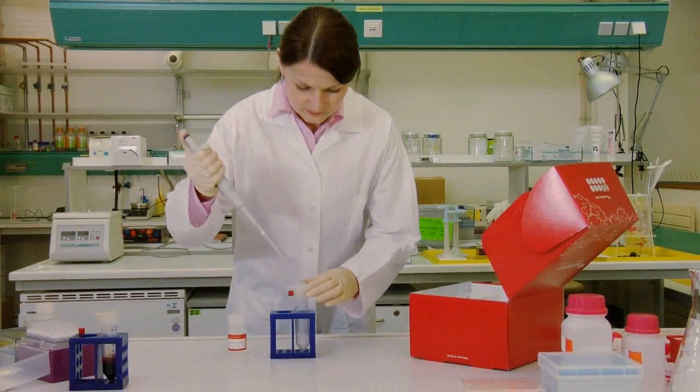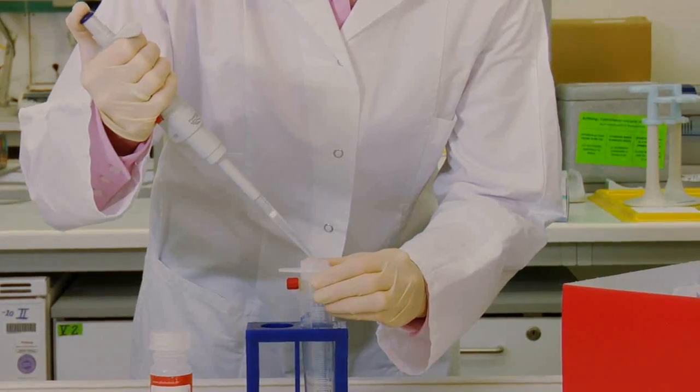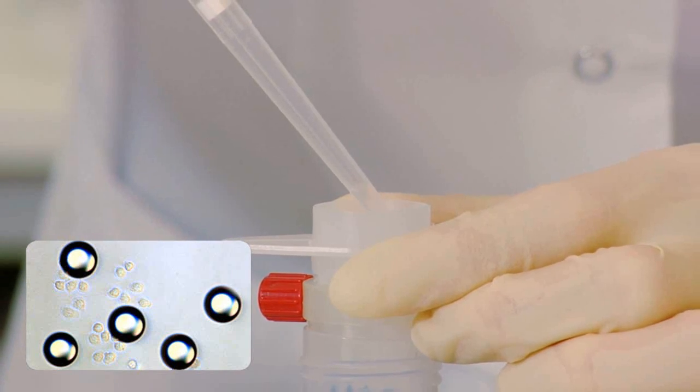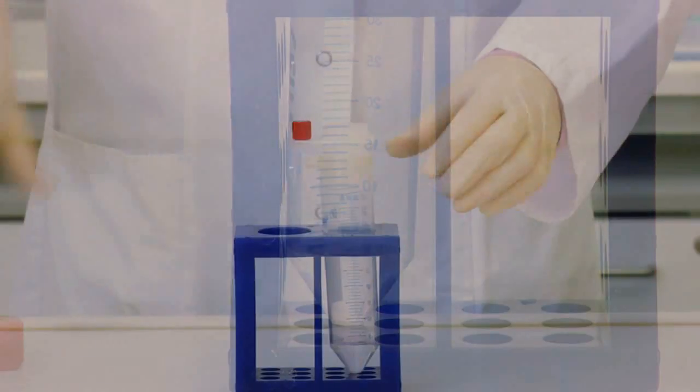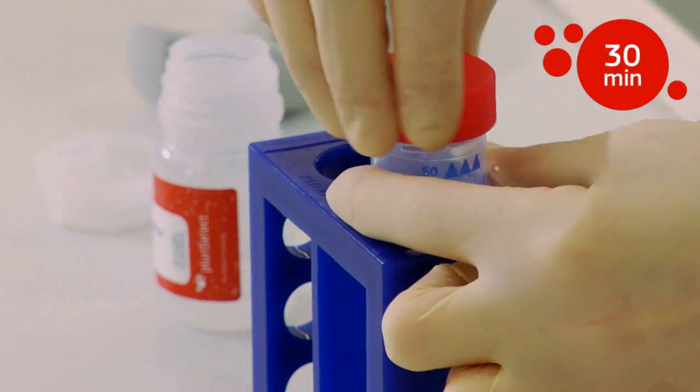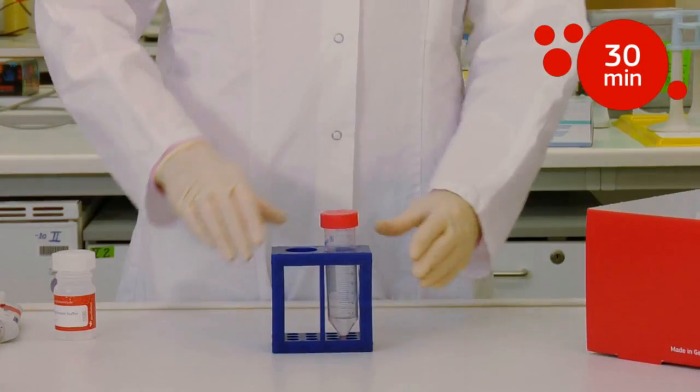Ten minutes later, the buffer is carefully pipetted up and down so that the cells are released from the catcher particles. If the valve on the connector ring is then opened, the released cells flow into the reaction tube. They are now pure and available for further experiments.